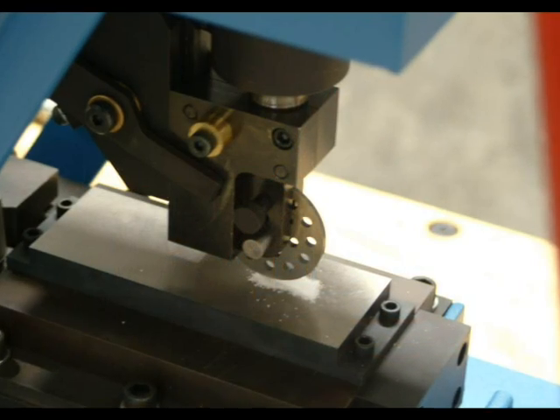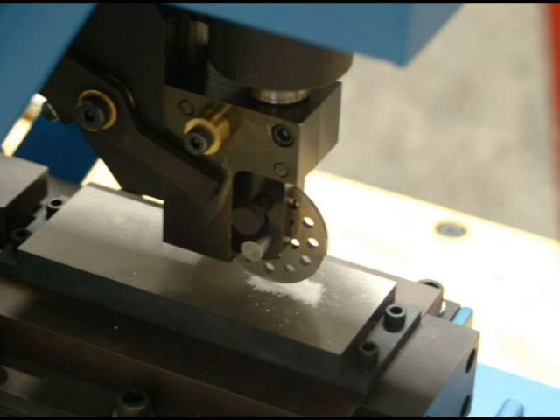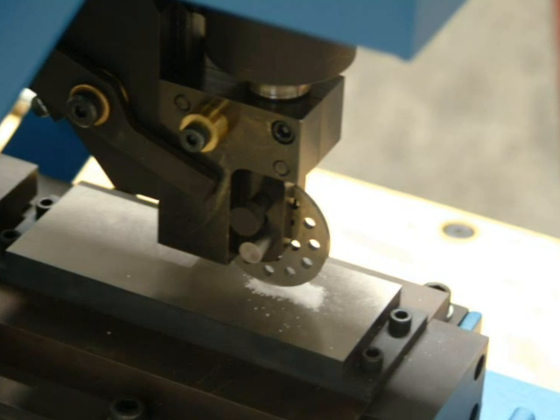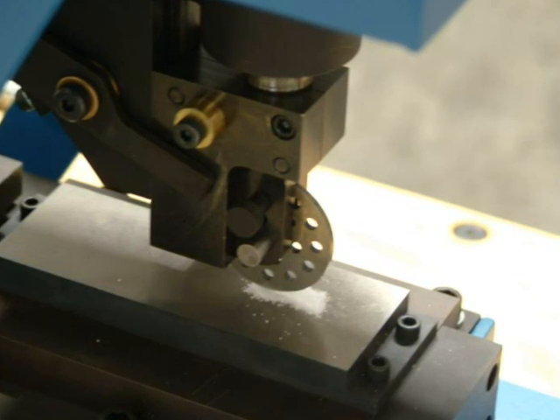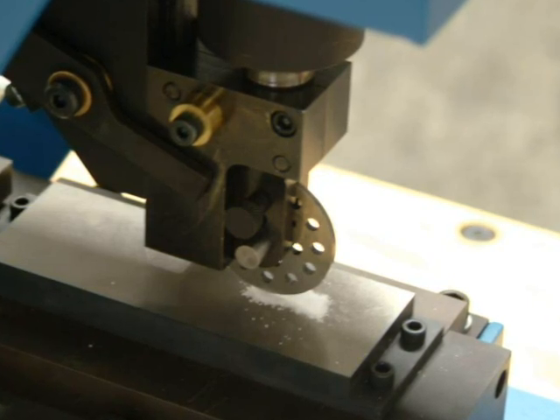The concept of this design is to simulate an event of two objects sliding past each other with a known force pushing them together and having a small amount of energetic material pinched between them.